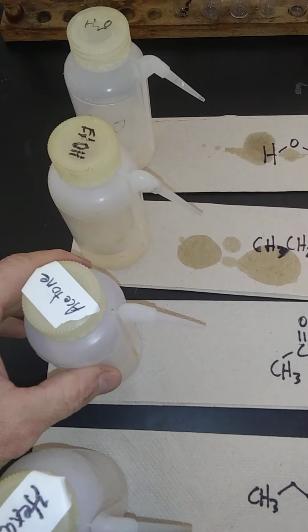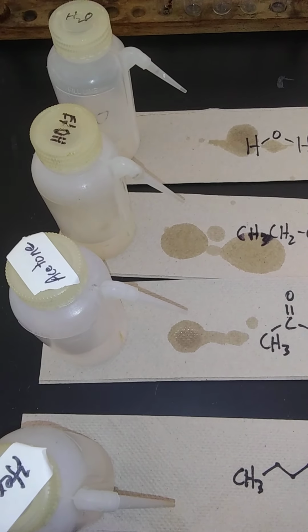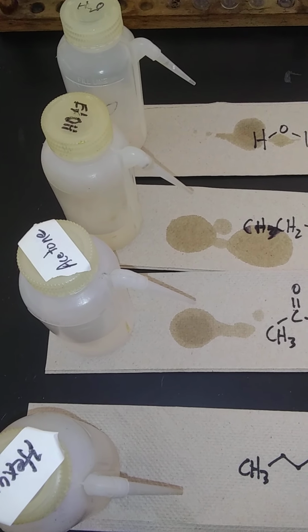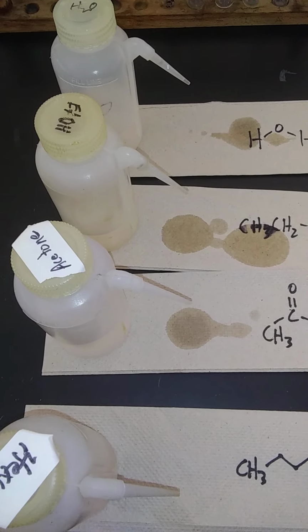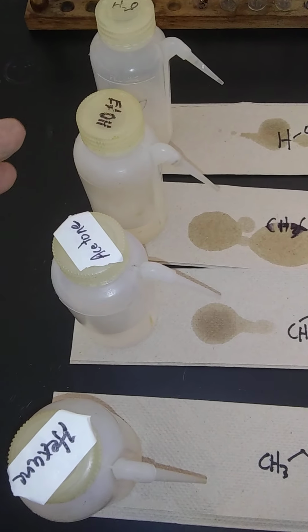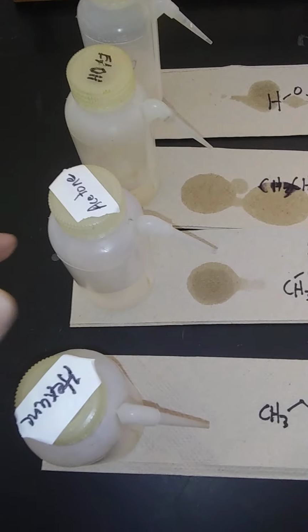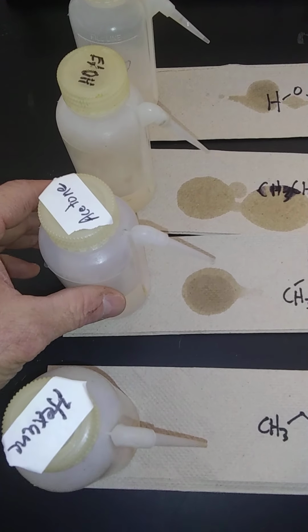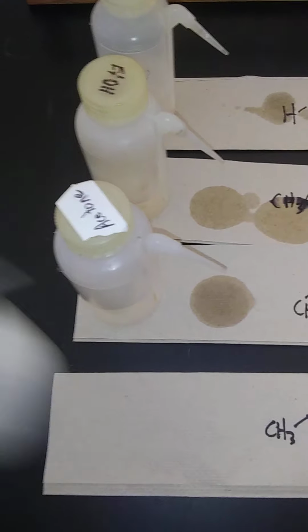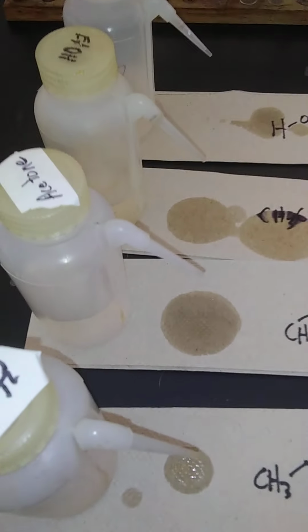I'll do the same thing with acetone. Now this one, I didn't even squeeze the bottle, and it's starting to come out, and it's not stopping. So let's see if it catches ethanol, catches up to it, and passes it. So ethanol, I had to squeeze the bottle to get it started, but now it's dripping. Acetone, I didn't even squeeze it, so it started and it's still dripping.